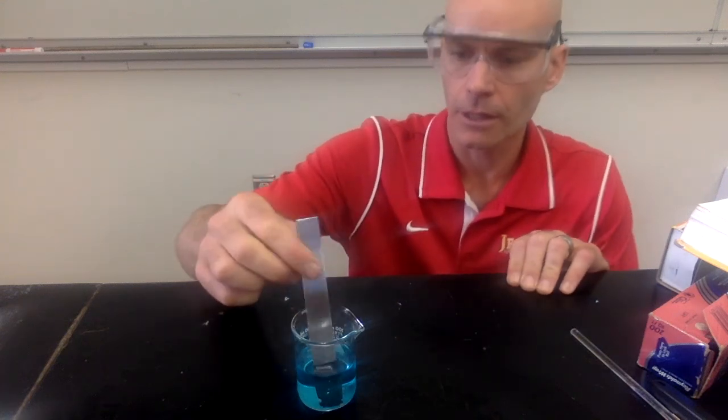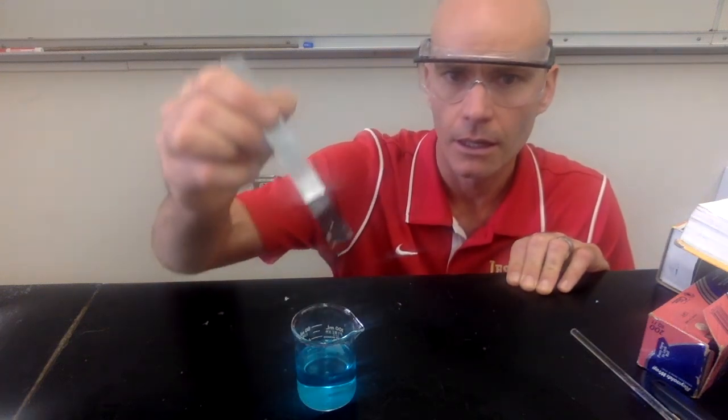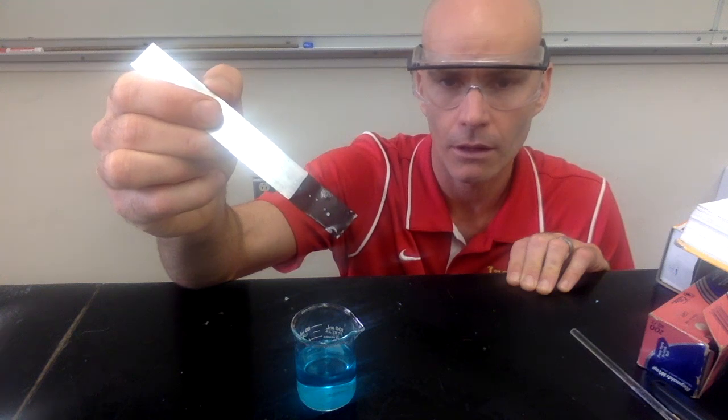All right, so it's been in here for a minute or two, so we'll take it out, and you can make your observations on the iron metal.